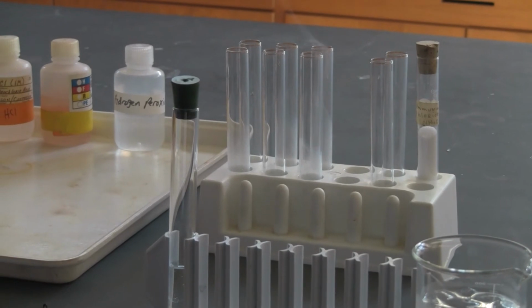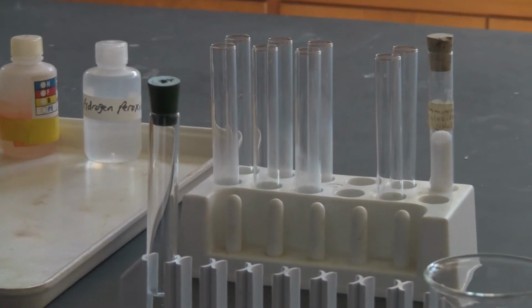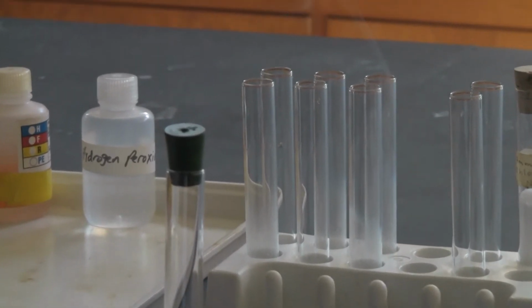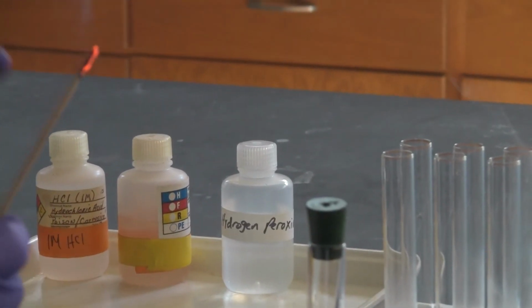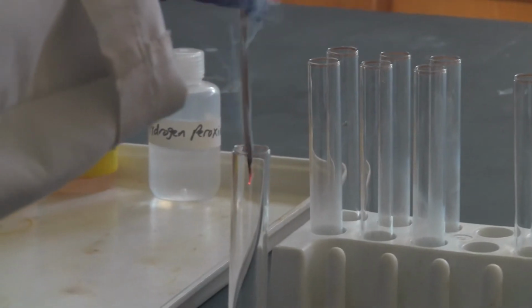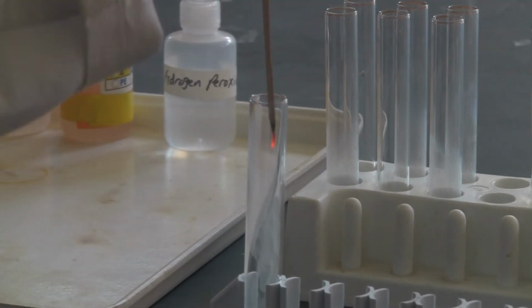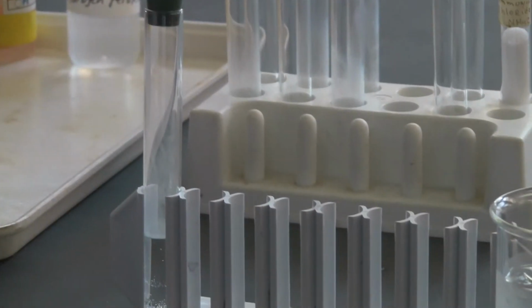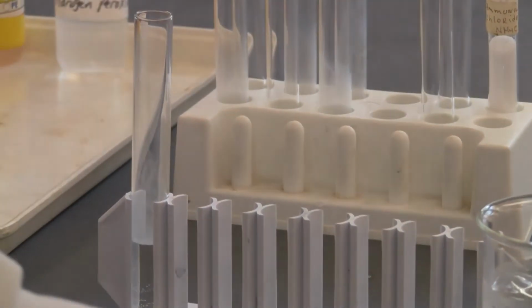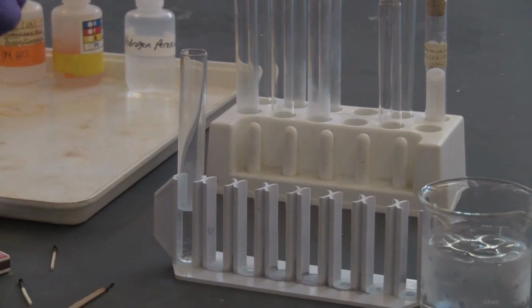Yeah, the gas is invisible. What I'm doing is following the procedure. I'm going to check the gas by igniting the splint, getting rid of the flame, and using just the glowing part. Just put it in there. Nothing really happened. You can see it's pretty much the same thing. Then I'm going to add a catalyst to see the difference. Now we are going to have a catalyst involved in this reaction.